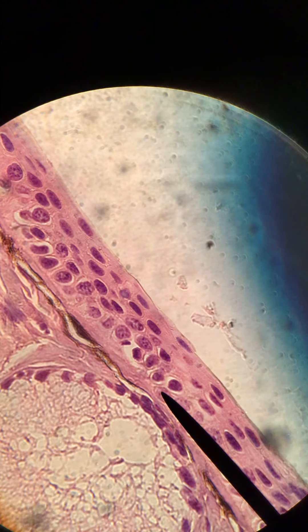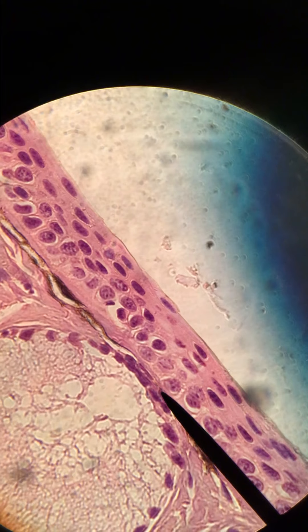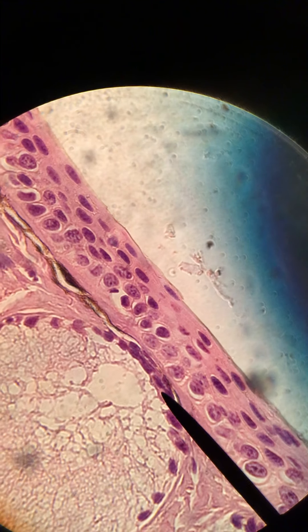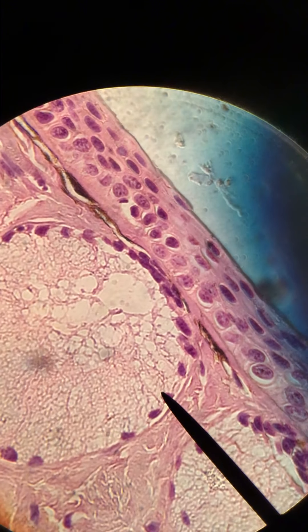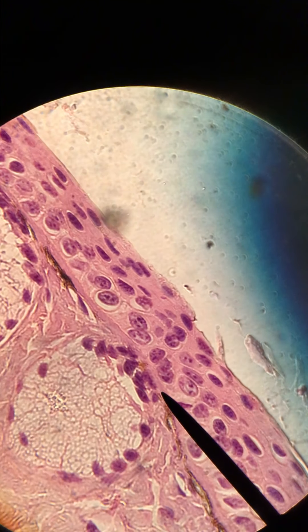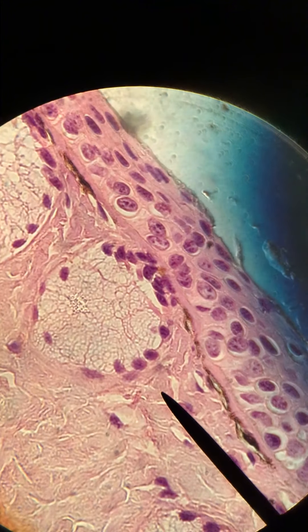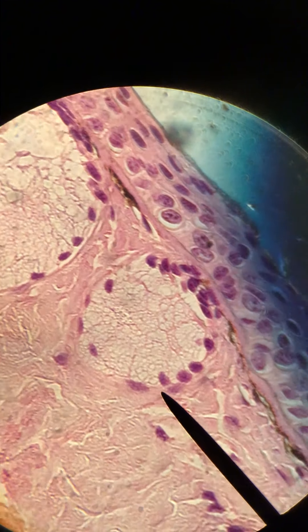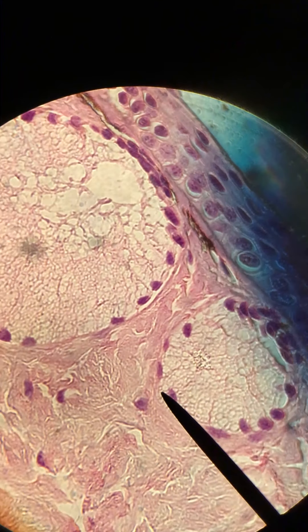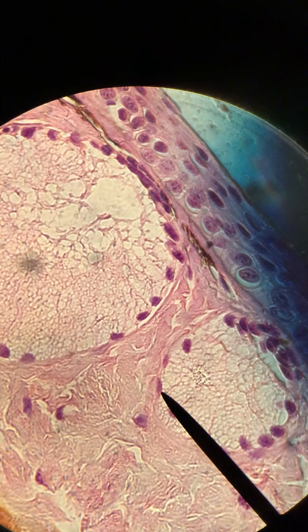We also want to point out that there are simple squamous epithelial cells shown here, where the pointer is hovering right now. These line blood vessels that are present just below the stratified squamous epithelial layer. All these guys lining the blood vessels.